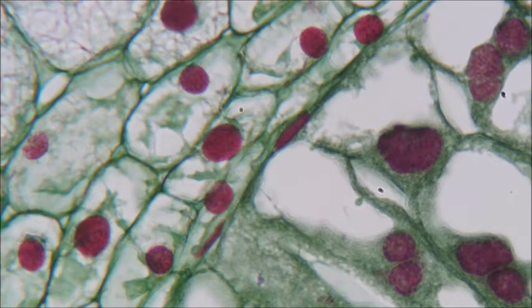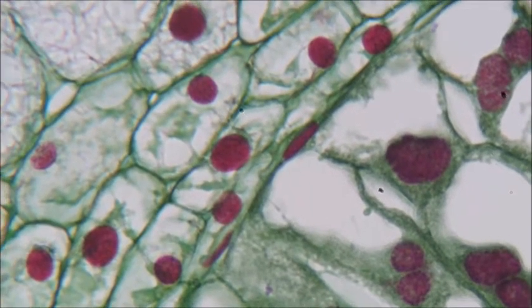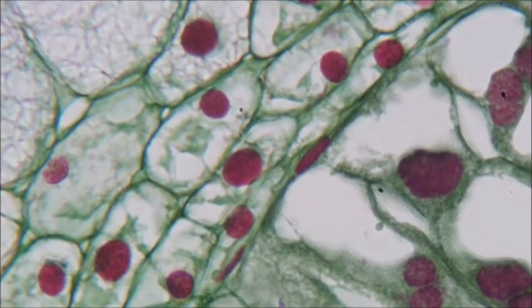All right, now these are some plant cells of Lilium, which is a type of plant. Now you can see this has been dyed with a couple of things. That's why the nucleuses look so dark. Those pink circles are the nucleus, which contains all of the genetic material. And you can see the plant cell walls.